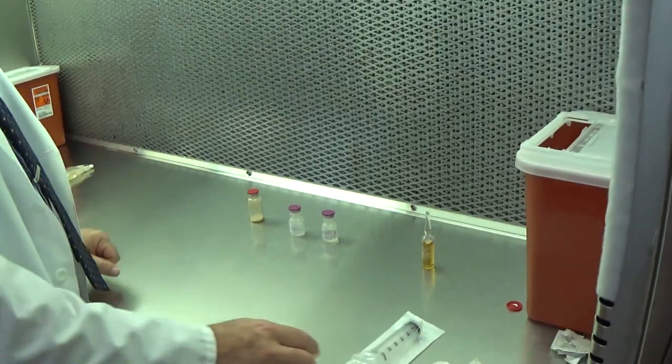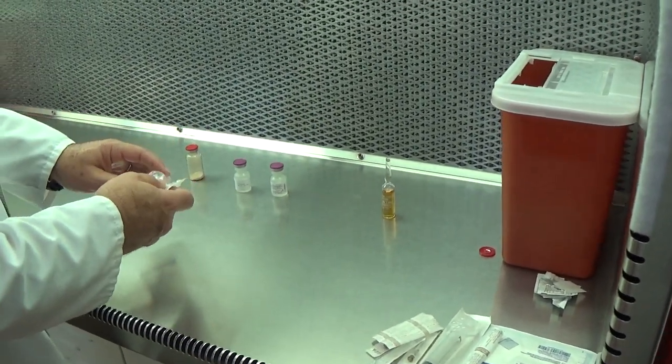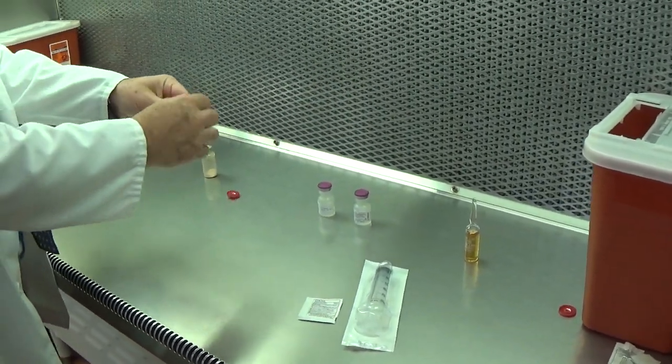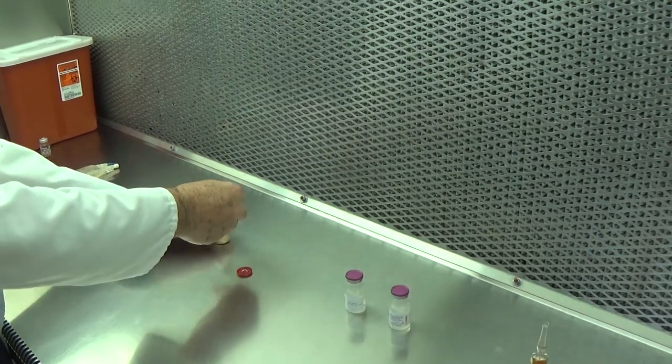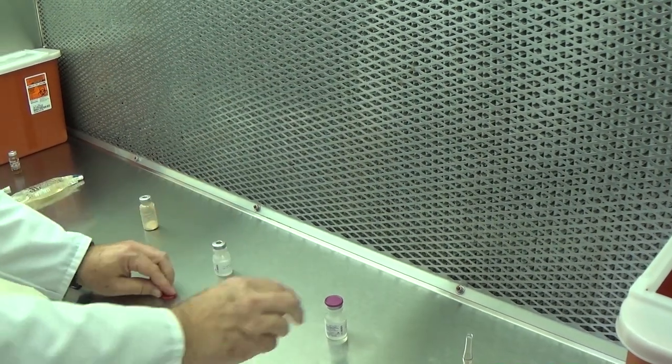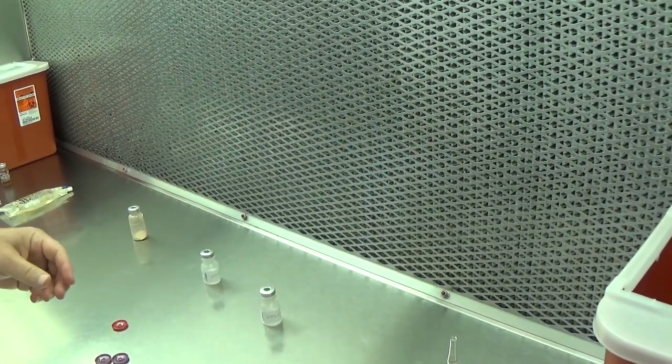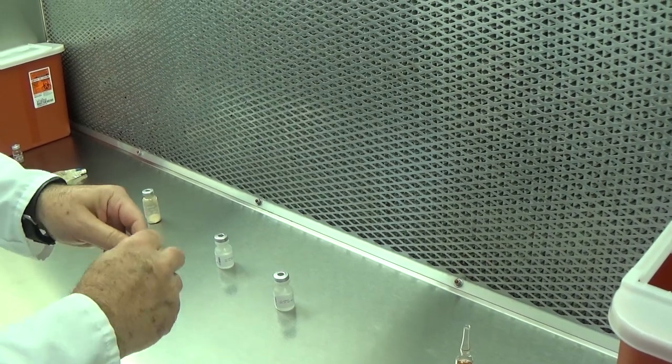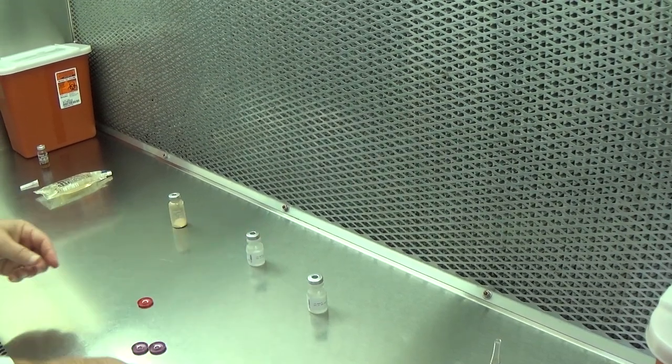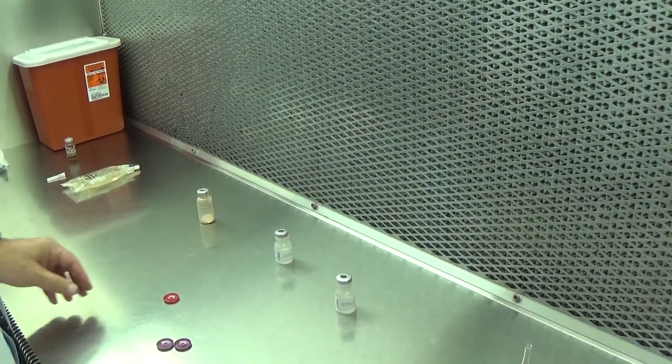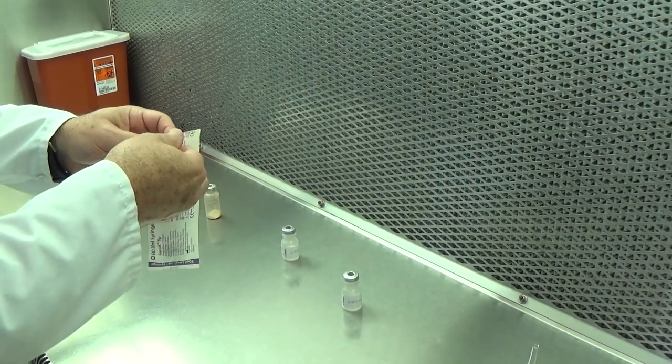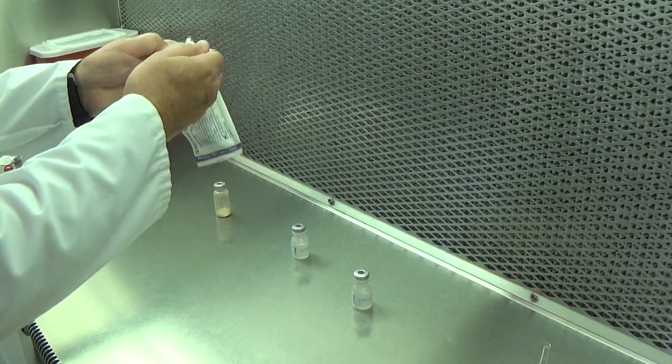If I am reconstituting a powder, I would follow the same techniques. One wipe, and I allow those surfaces to dry. While they're drying, I assemble my needle and syringe.